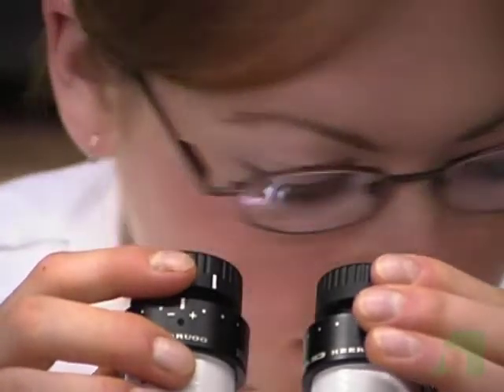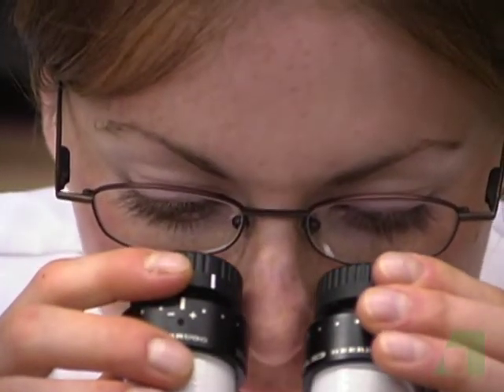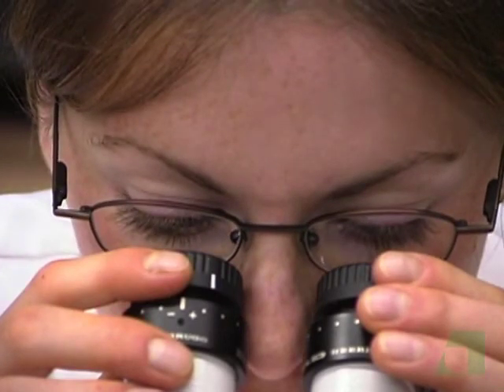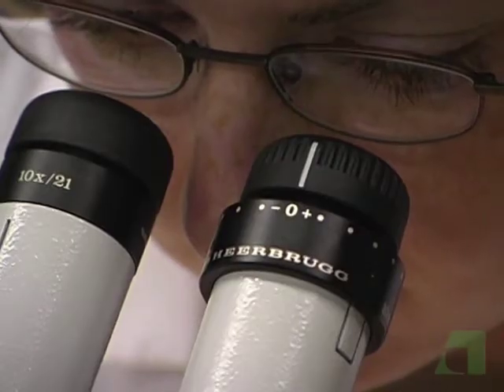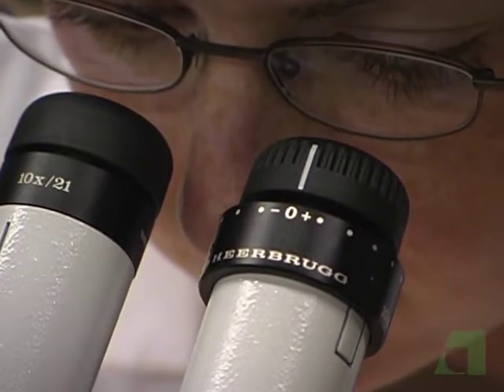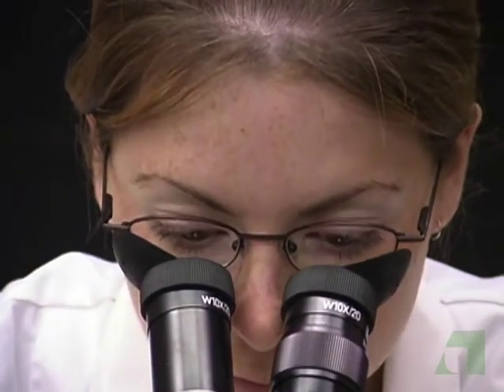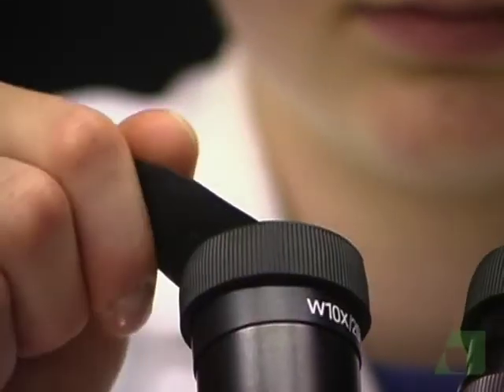Most microscopes today are designed to allow people to view objects while wearing eyeglasses. Keeping on your glasses maintains the visual improvements that they provide. Most ocular lenses of microscopes use rubber-like rings around them to protect eyeglasses from being scratched. Some of these rubber-like tops can be used to exclude extraneous side light for people without eyeglasses. These may be folded down for people who do wear eyeglasses.